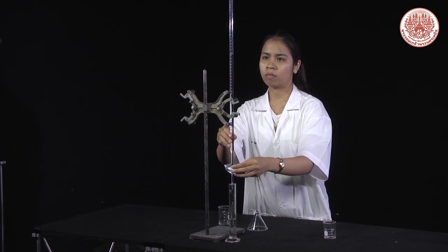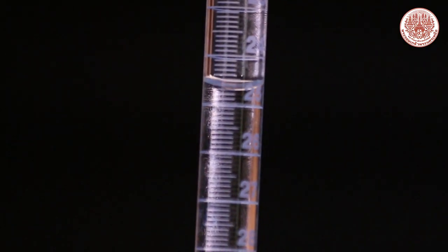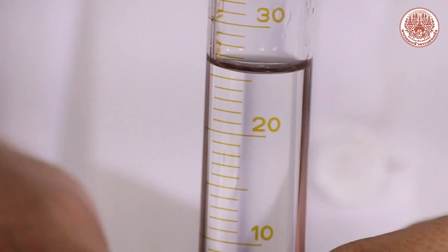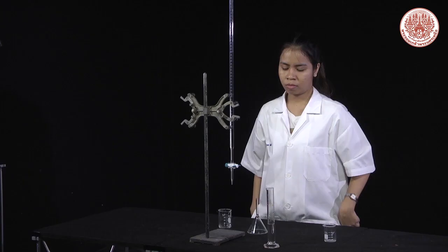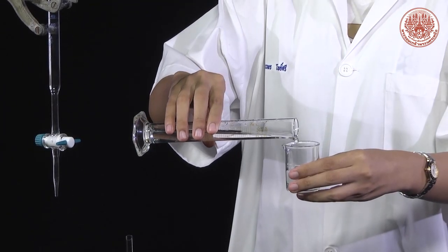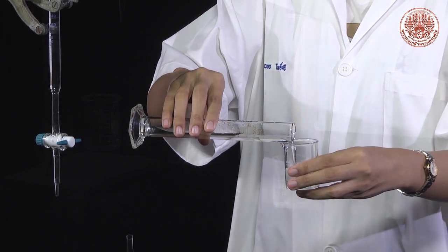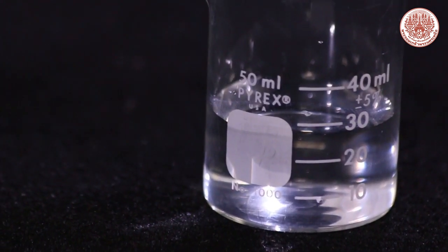Transfer 25 ml of tap water from the burette to a graduated cylinder and read the volume. Then transfer the tap water to a beaker and read the volume from the beaker.